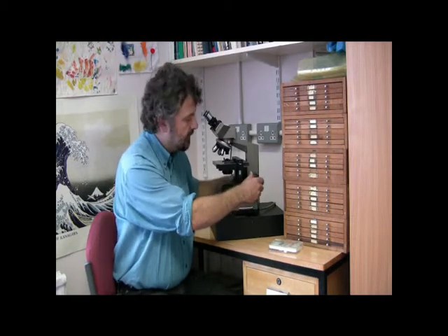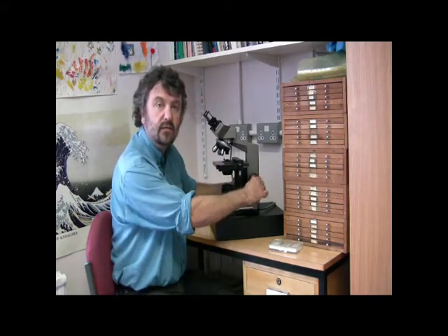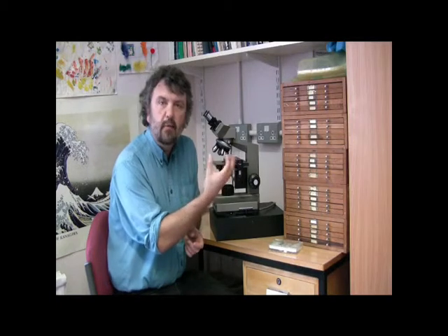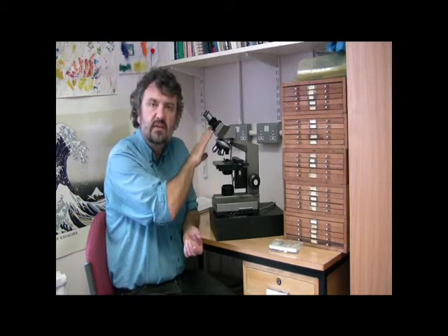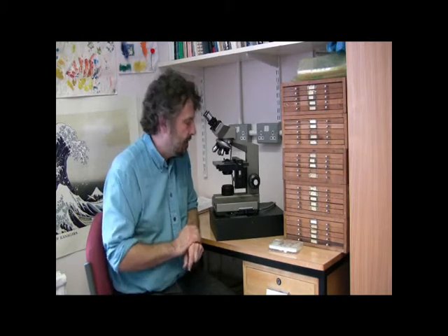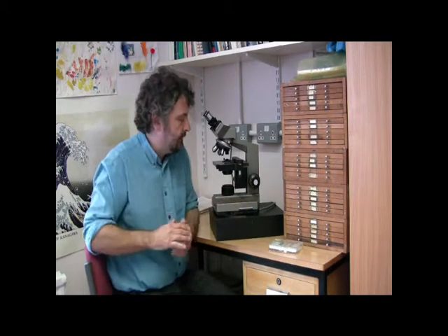At the back here we have the focusing mechanism. The big wheel is for major focusing, and the smaller inner wheel is for more fine tuning of the focusing. Underneath the stage we also have a lever which controls what we call the iris diaphragm — that's like a camera aperture which controls how much light is let in underneath and through the slide, affecting the brightness of the light you see coming through the optics at the top. Right at the bottom here we have the light source. On these electronic microscopes it's simply an electric light, but on the more old-fashioned microscope that could be a mirror that you have focused sunlight through.